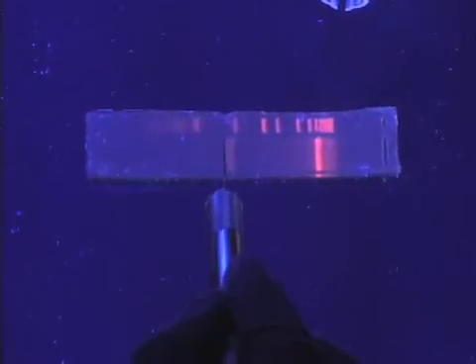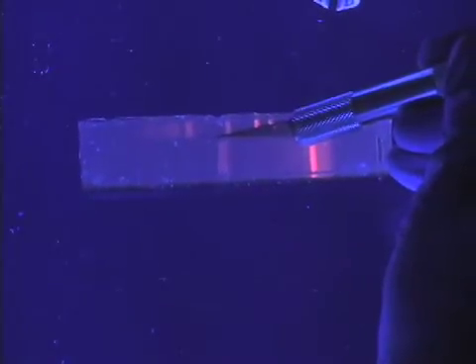Following electrophoresis, the desired fragment is neatly excised from the gel using a brand new razor blade, taking care to trim the gel slice as close as possible to the band of interest.